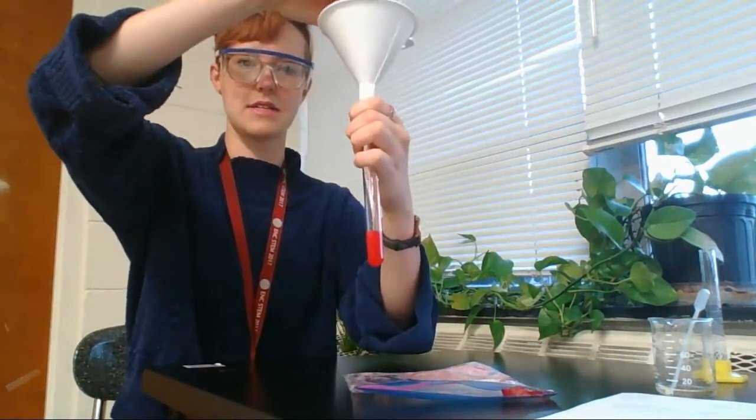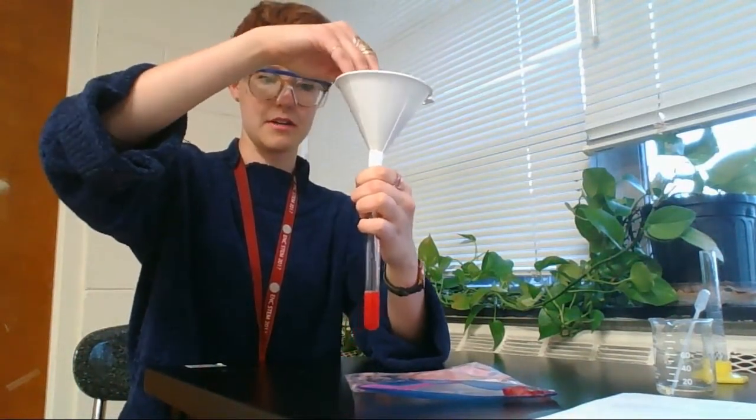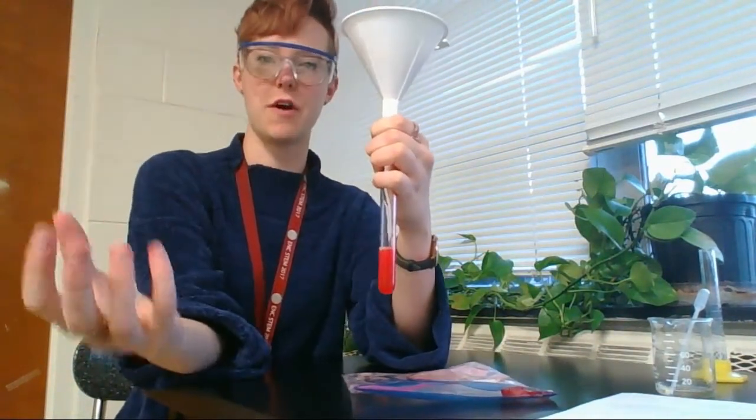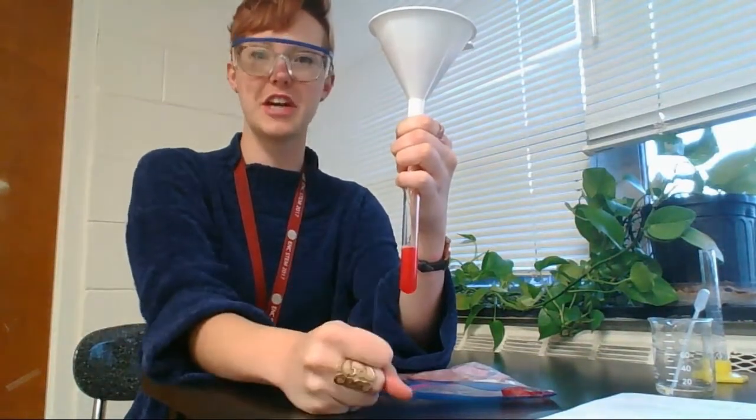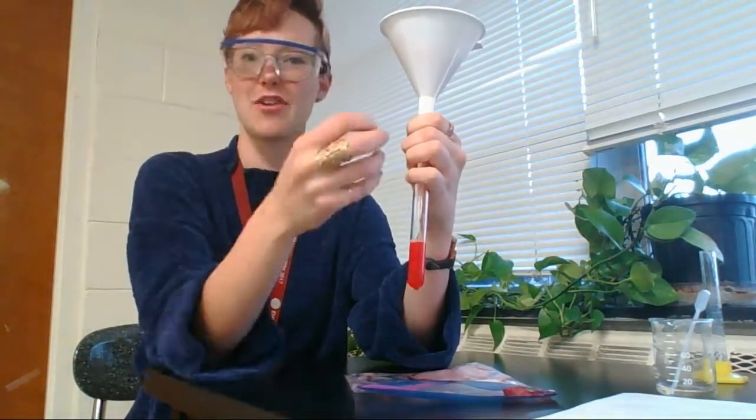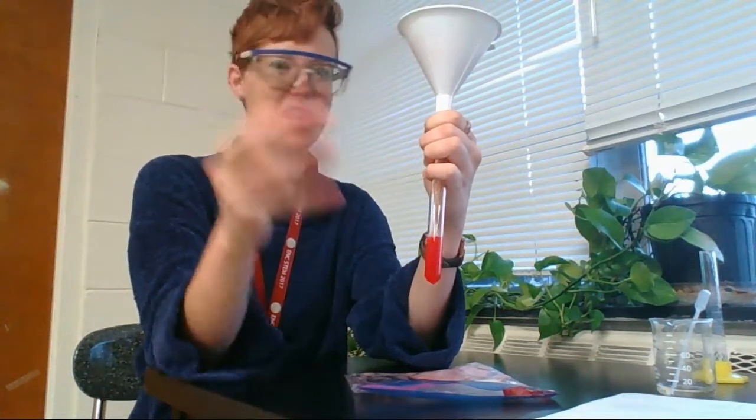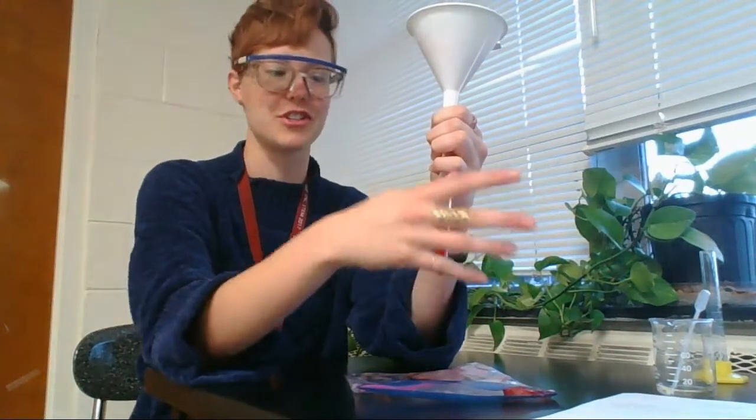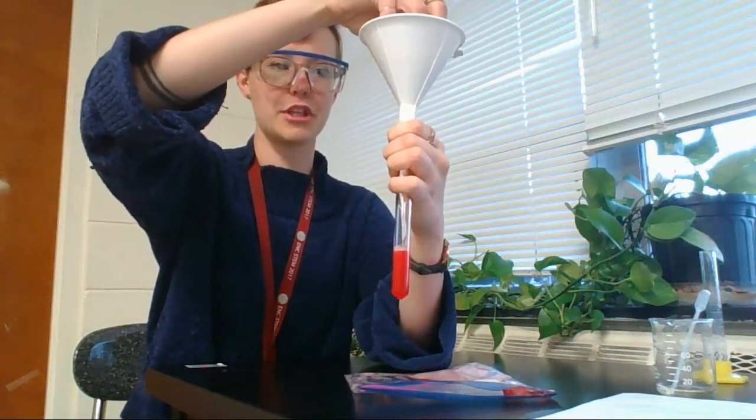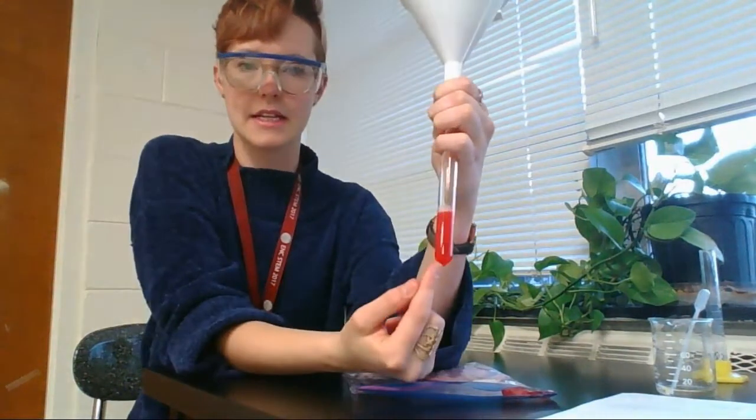What I'm going to do is I'm going to kind of press down on my paper towel. I folded it into here and I'm pushing down on it to make sure I can get only the liquid. What you've done so far is you've taken your strawberry and you've crushed it up and you've broken down those strawberry cells. That cell wall, that cell membrane, it's all broken apart. All the guts of the cell, the cytoplasm and the mitochondria, chloroplasts, the nucleus are just all over the place now in this mixture. And so now as we're pushing through, we're getting only the smallest molecules. Our DNA is somewhere inside this mixture.